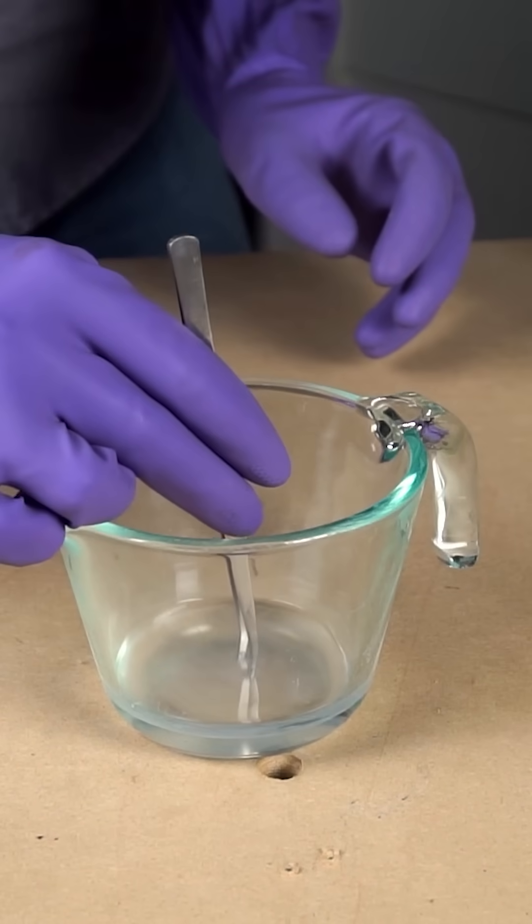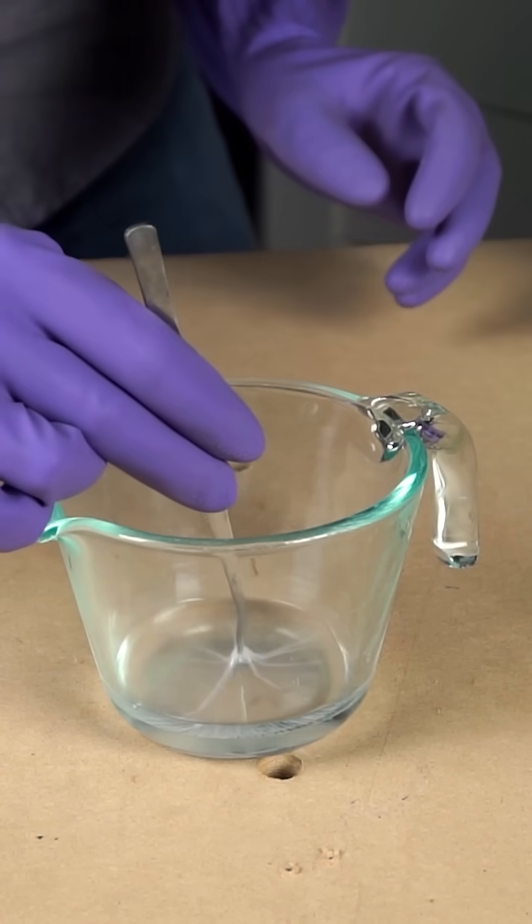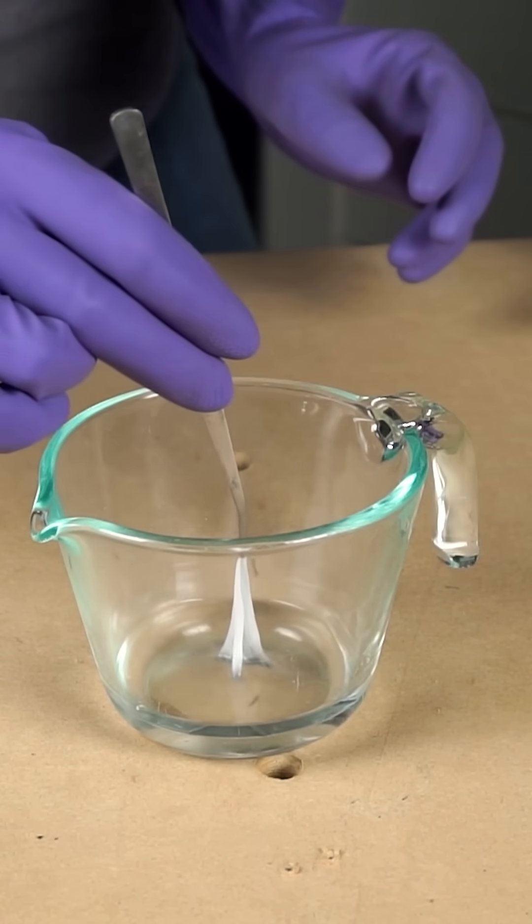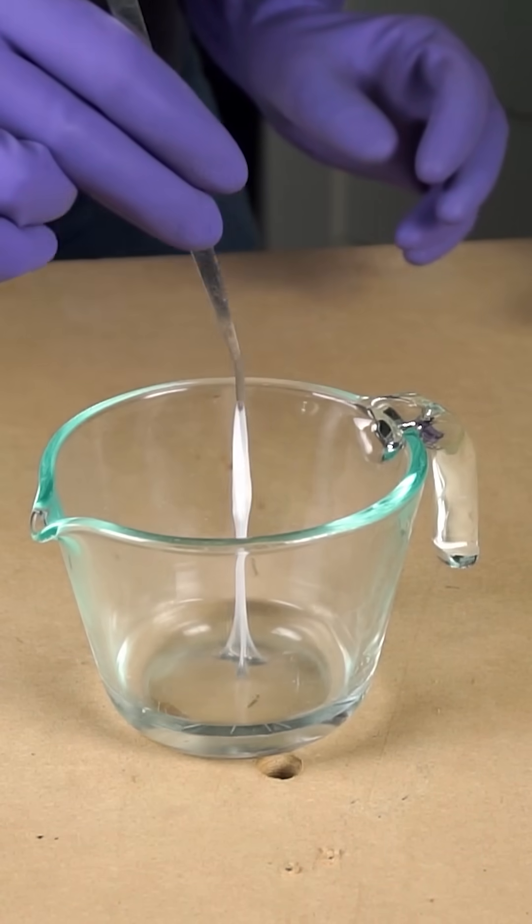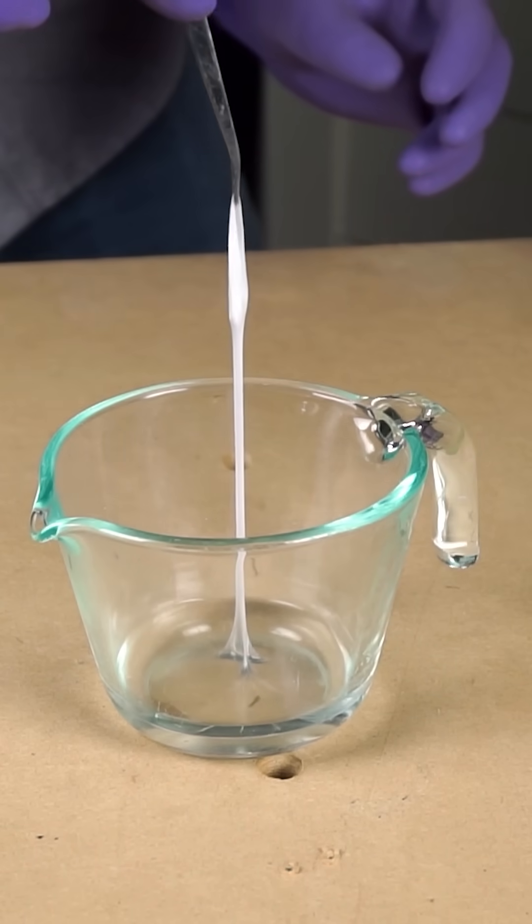Okay, here we go. Then I just grab the polymer it forms in between and pull, and it'll keep pulling the string out of the center there. Look at that.